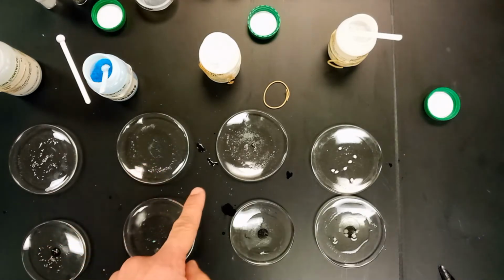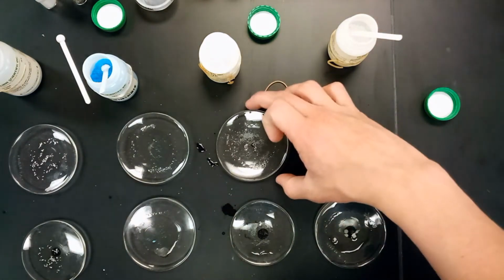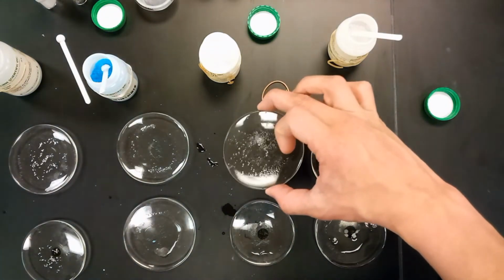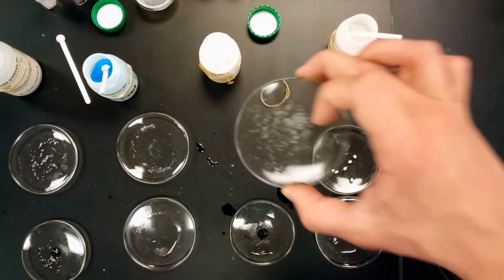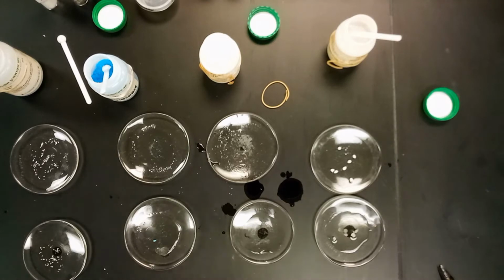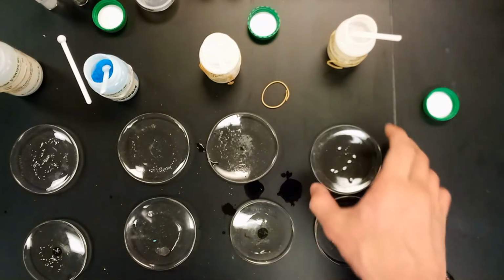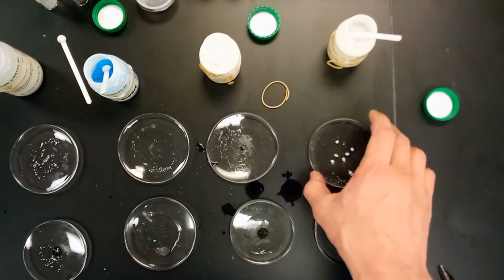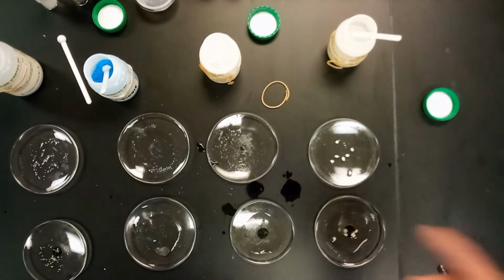The dextrose has slight dissolving. I'm not 100% sure how well you could see it, but it does look like it's dissolved a little bit, but not all of it, of course, so maybe we'd call that a slight dissolving, or slight solubility, my bad. And with paraffin wax, we see that it's actually changed, so it doesn't look like this. So we'll do maybe a better representation here.